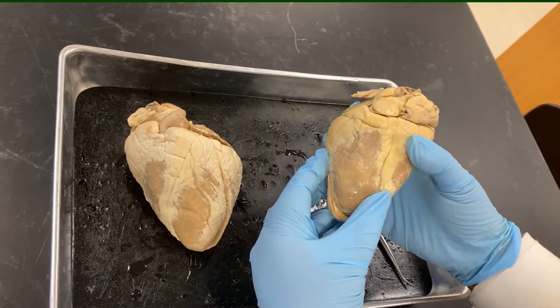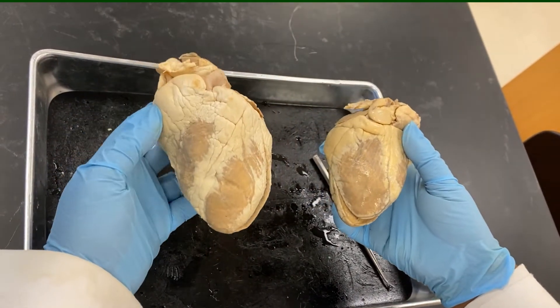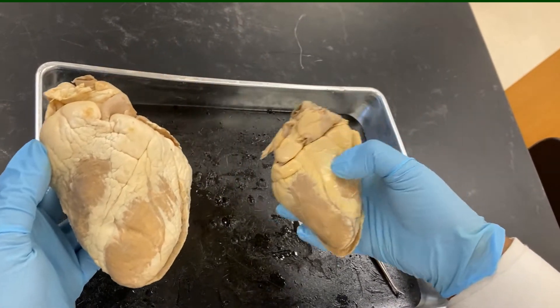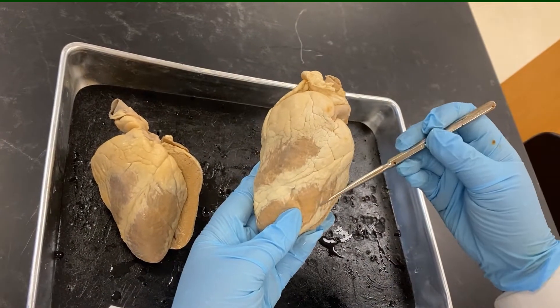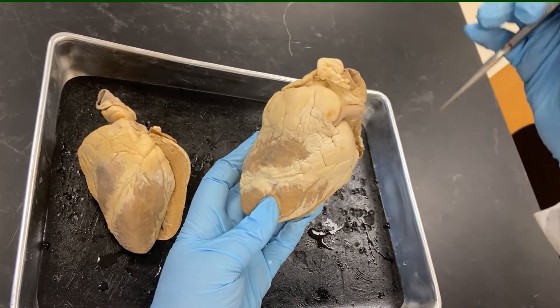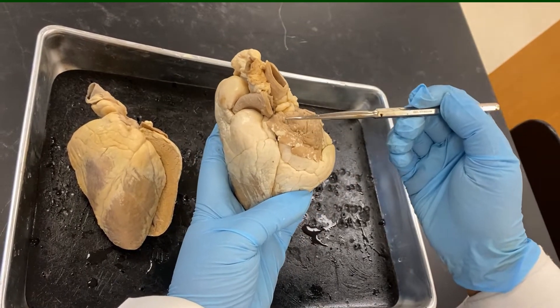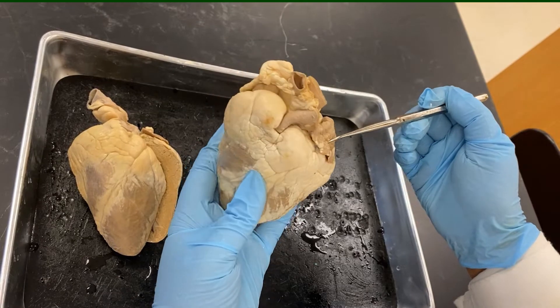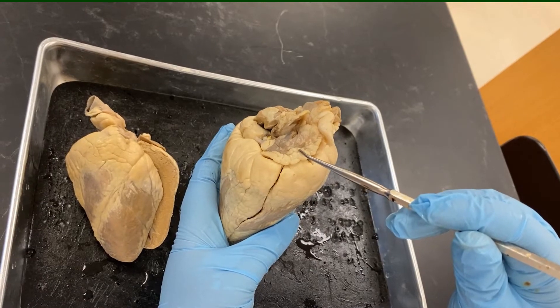I will show you the anterior and posterior view side by side. On the left is anterior, on the right is posterior. Let's go over the chambers. This is the left ventricle, right ventricle. Here will be the left atrium, right atrium. Covering the atrium, these flap-like structures are called auricles. This will be the auricle over the left atrium, and this one will be the auricle over the right atrium.